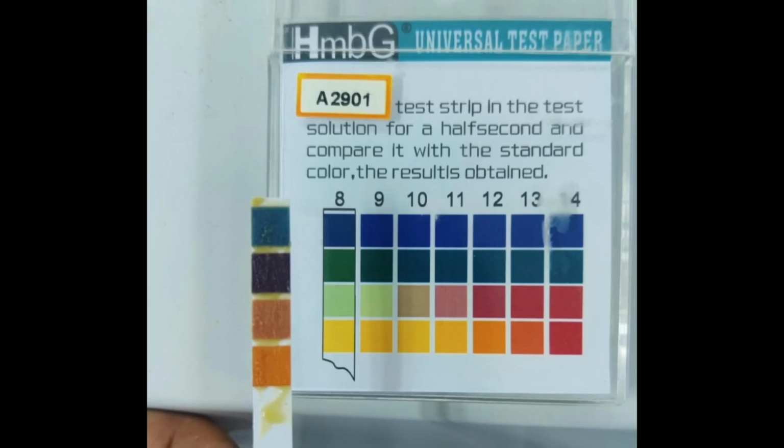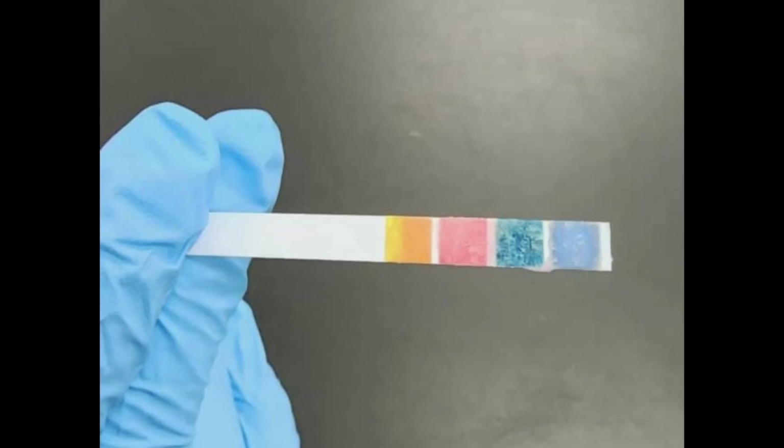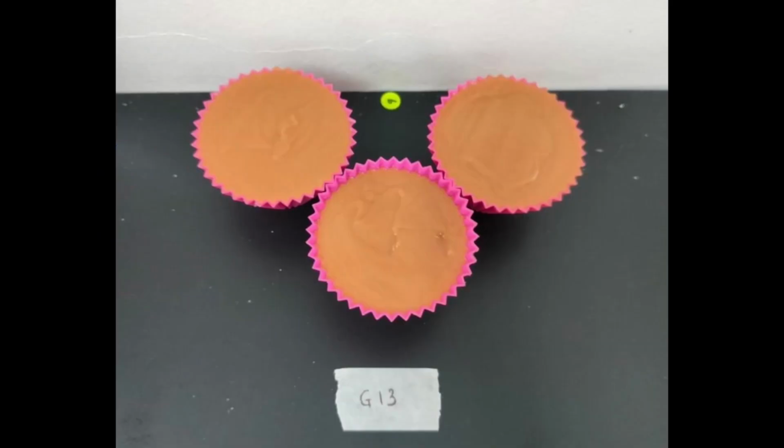Based on the result, the texture of the soap is smooth and creamy. It has a uniform texture because of the shape of the silicone mold, and it feels silky when touched. The color of the soap before the drying process is light orange. After 24 hours, the soap turned pink. The soap changed color due to natural ingredients in the soap.